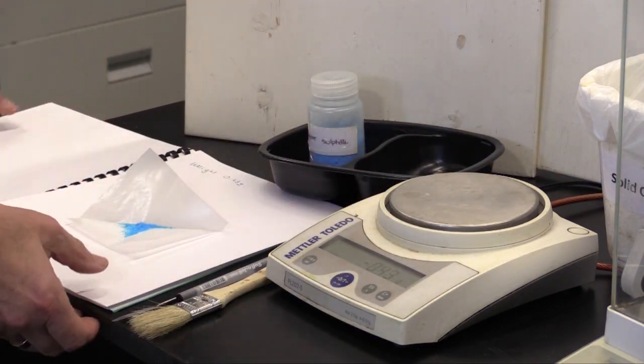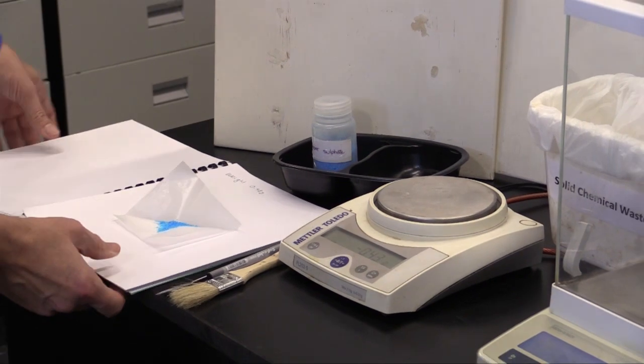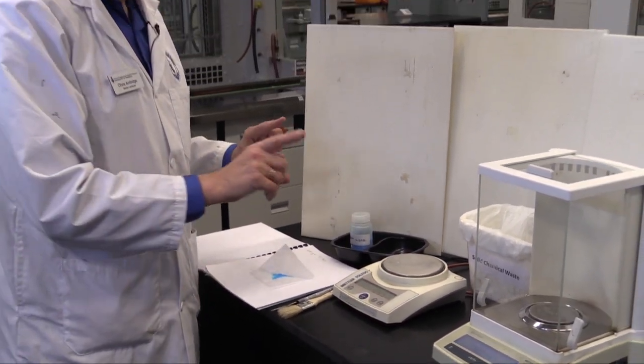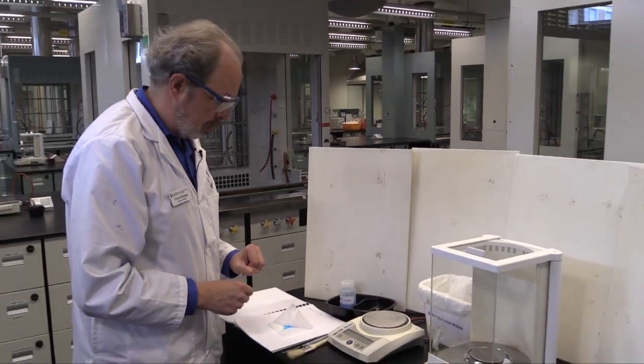Incidentally, the notebook is actually quite a good tray that you can carry stuff to and from your workstation. Let's move on and try doing the same kind of weighing using the analytical balance.